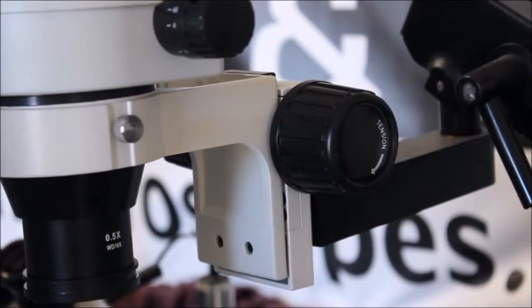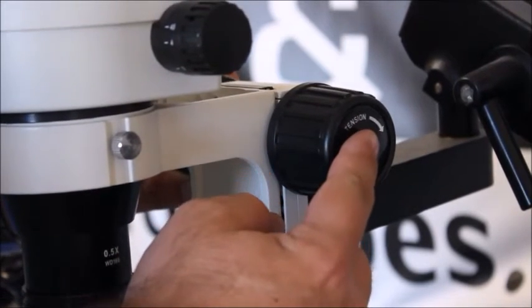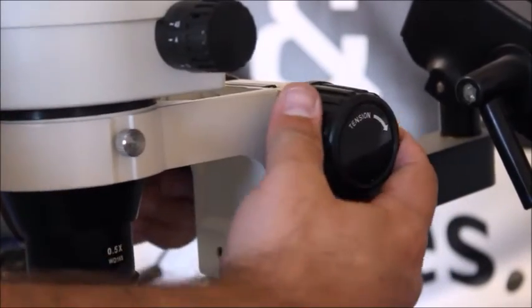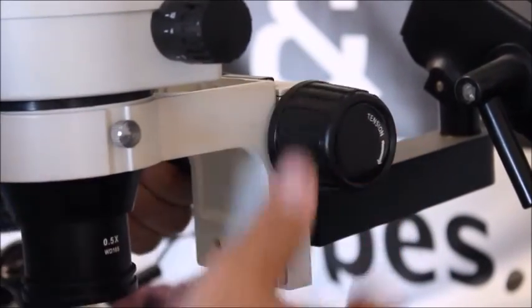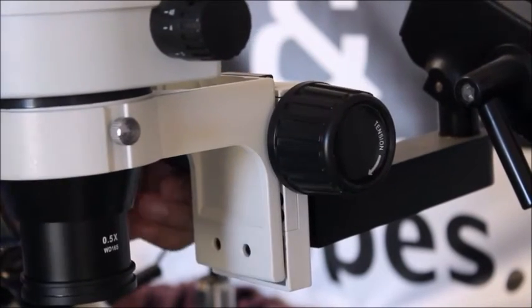Now it's important to note some of these do not function this way. So you always want to look for the tension label because if it's not designed to be that way you can break your entire focus mechanism. If you ever have any questions you can always contact us and send us images as well.